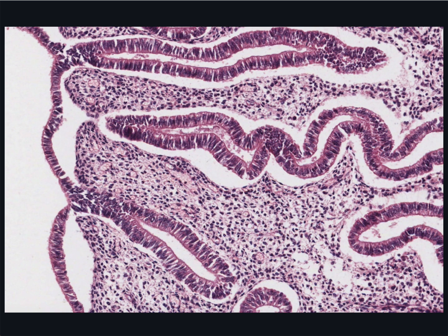The ends of the glands remain at the base of the endometrium in the basal layer. Their cells then divide rapidly and migrate out of the glands and over the surface of the endometrium. So you can see a continuity of two epithelia and can imagine the sheets of cells being pushed out of the glands. I'll show you this happening in the next section.